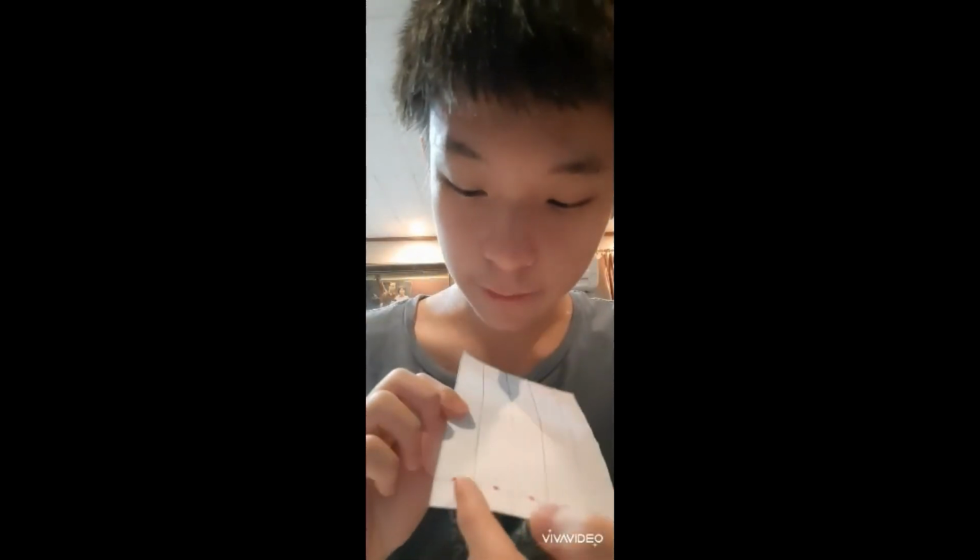Why 4? Because the last one will be multiple colors, or 2 or more colors. So these are the markers. This is a mix of pink and orange, and you can use any color dye. You can use color dyes, markers, or paint. I'm using markers because they're the easiest.